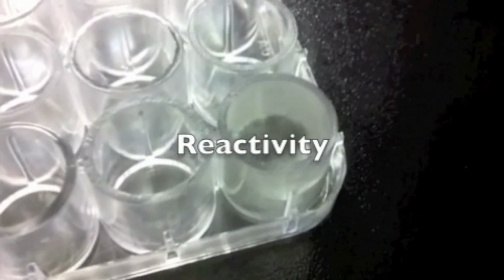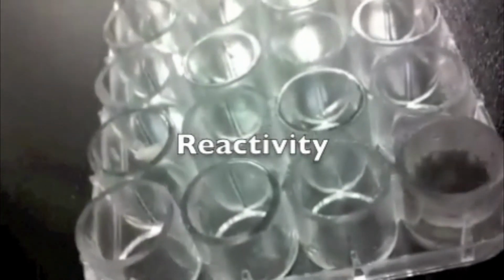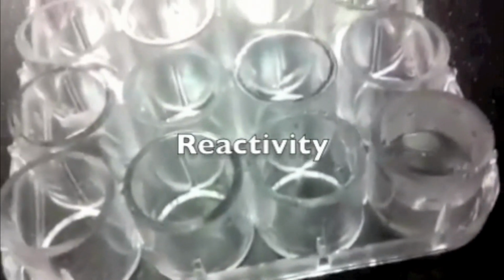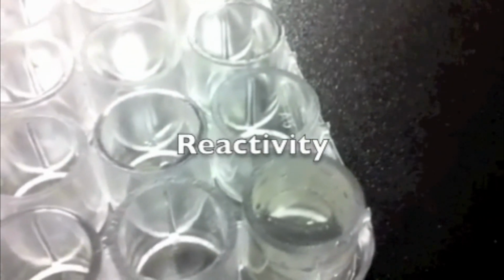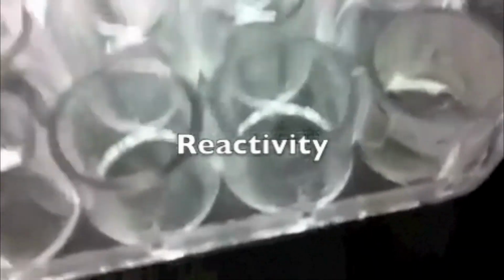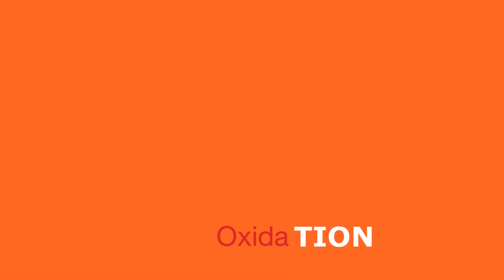As the hydrochloric acid mixes with aluminum foil, lots of bubbles are coming out and making a different shape and color. Although shape and color are physical properties, the atoms actually rearrange themselves in this case, which is known as reactivity. Now we're going to talk about the last chemical property.